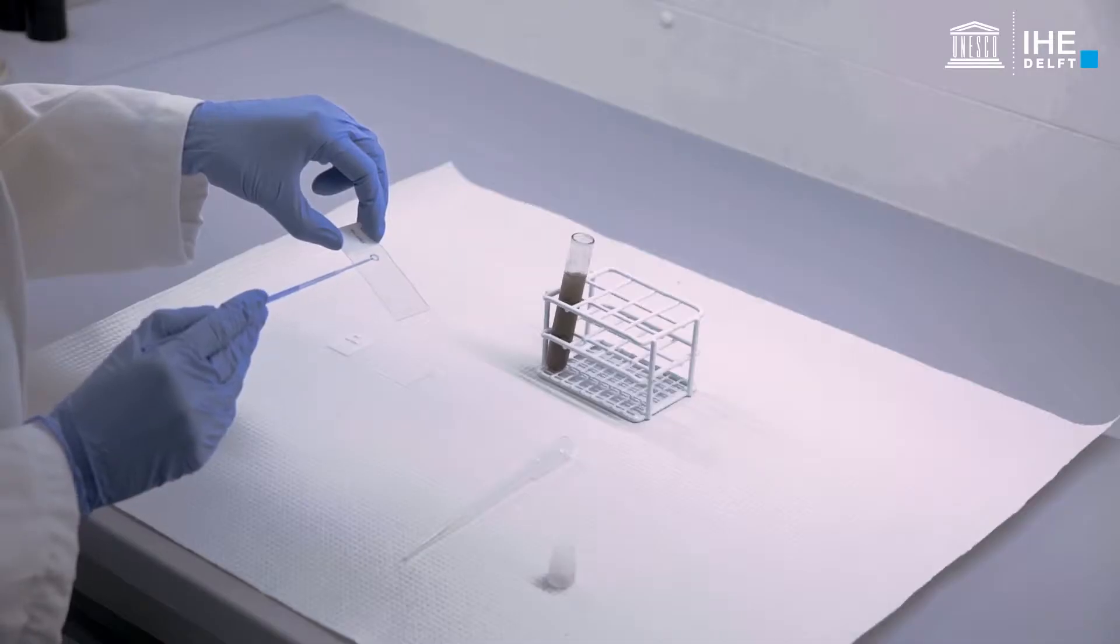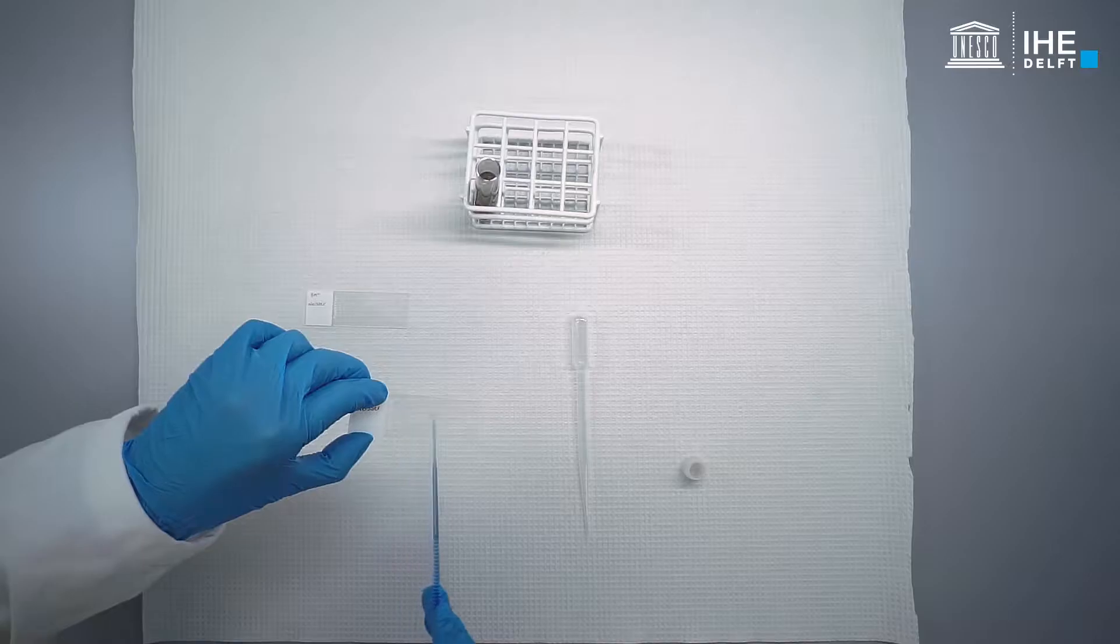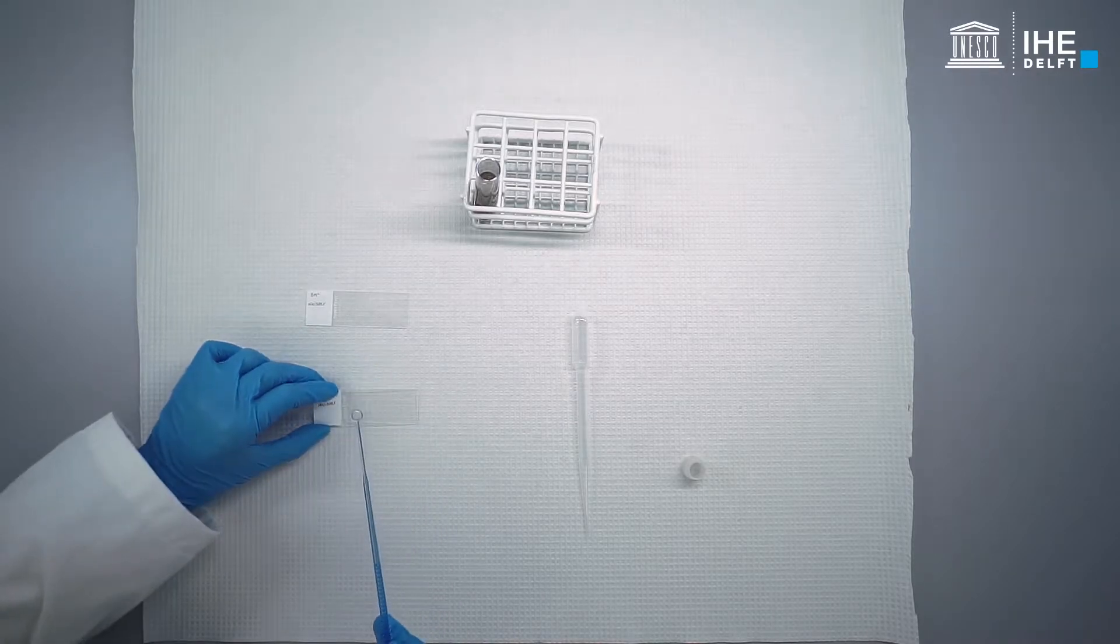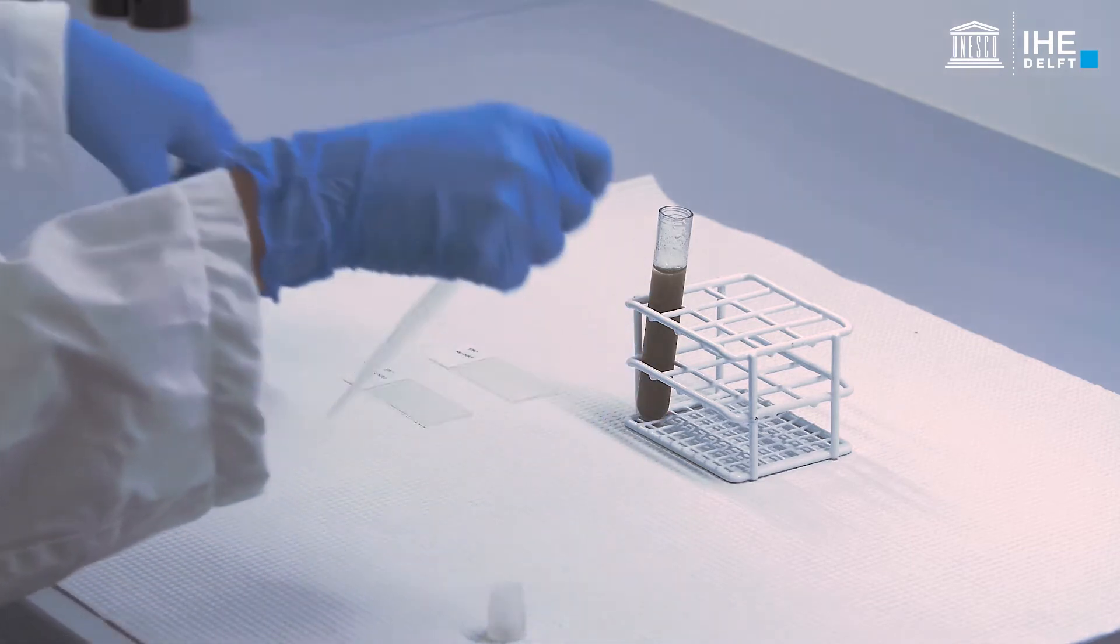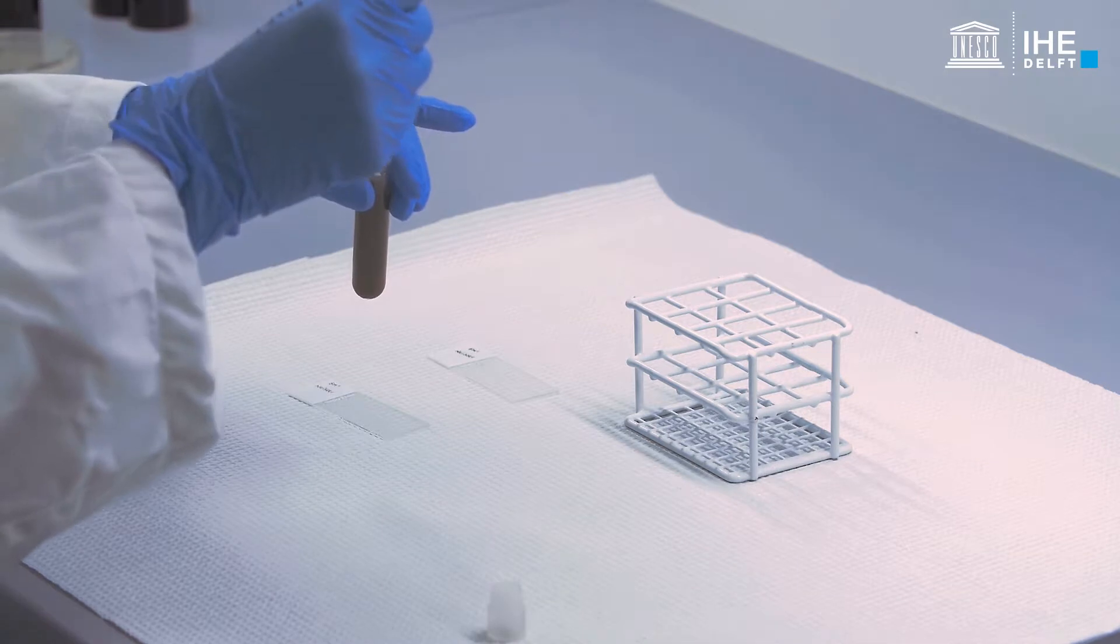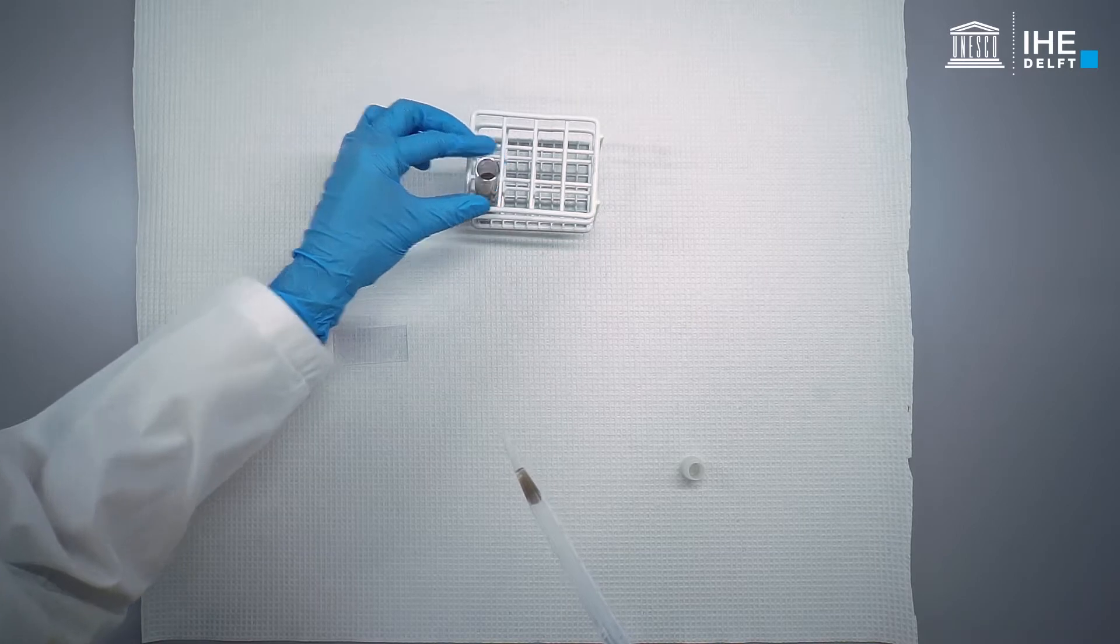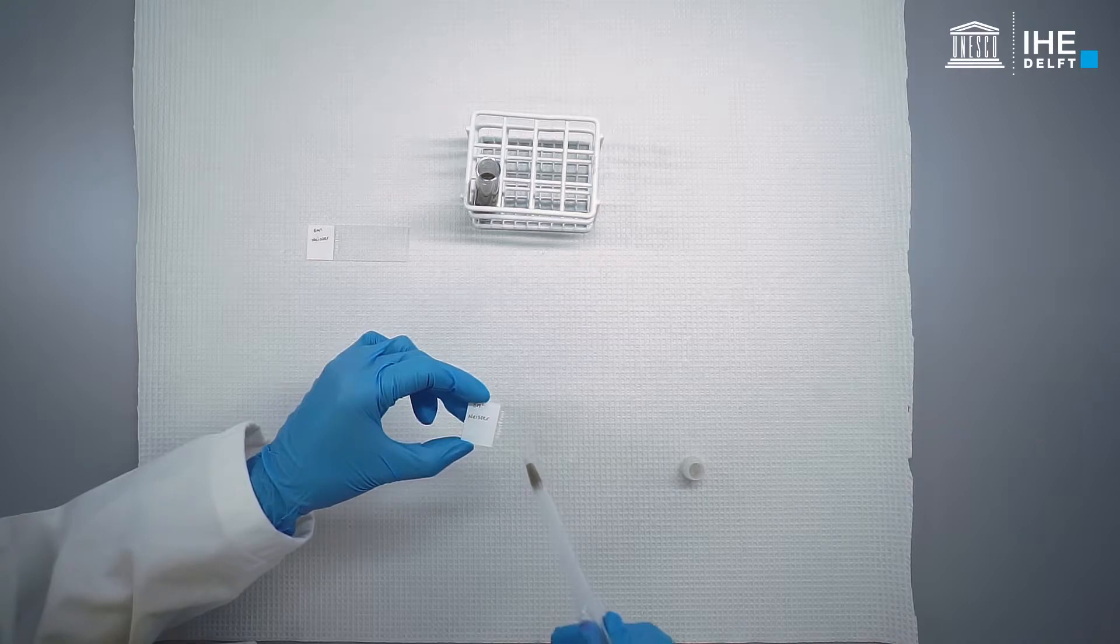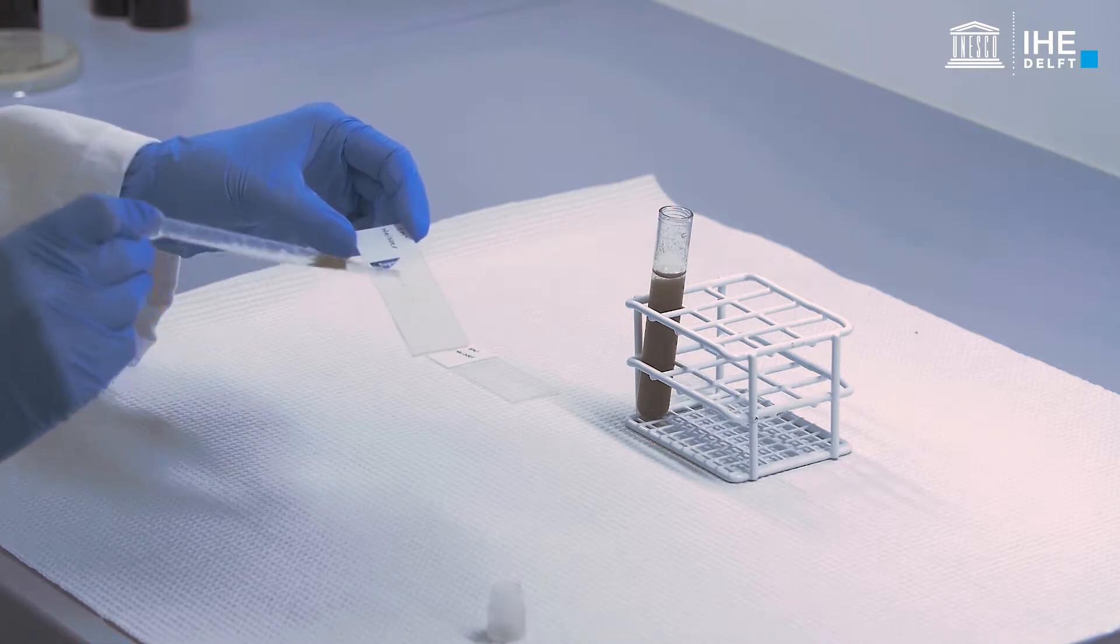This may take approximately 10 minutes. Heat fixing by passing the slides with a flame is usually not necessary for activated sludge samples. Repeat this process for each slide.